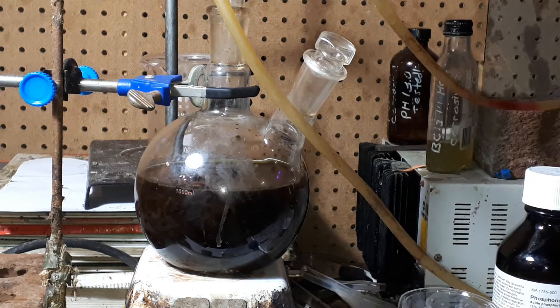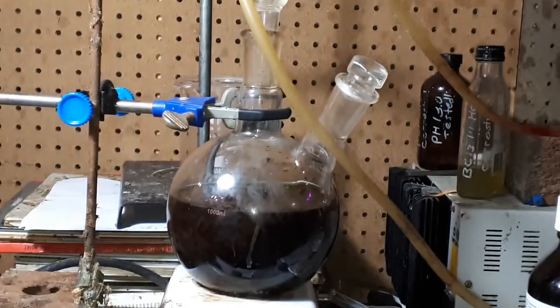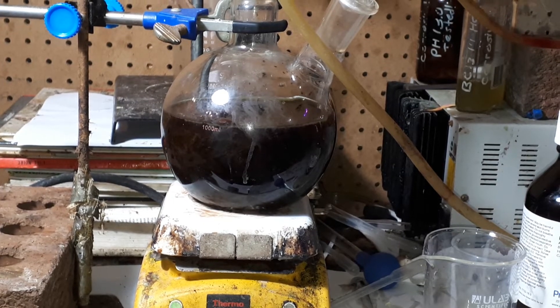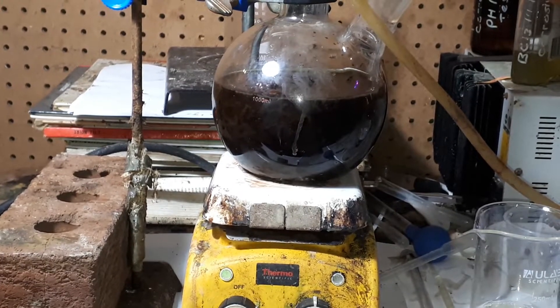Added to about 50% ethanol and 50% isopropyl alcohol. I added about 200 millilitres of water with about 10 grams of lye. And then I added a bit of phosphoric acid — 12 millilitres — to get the pH right.